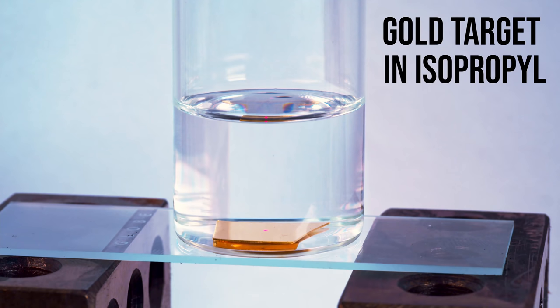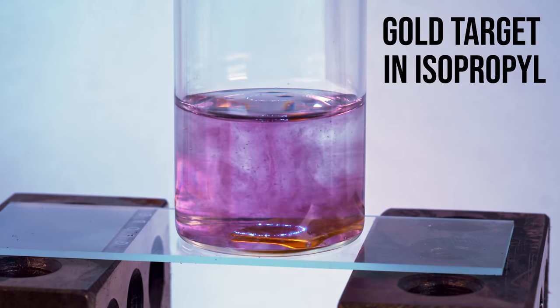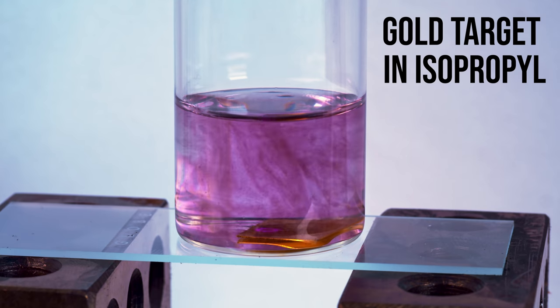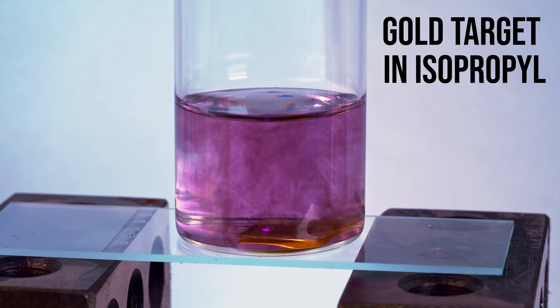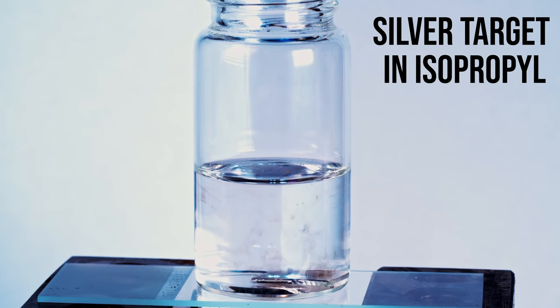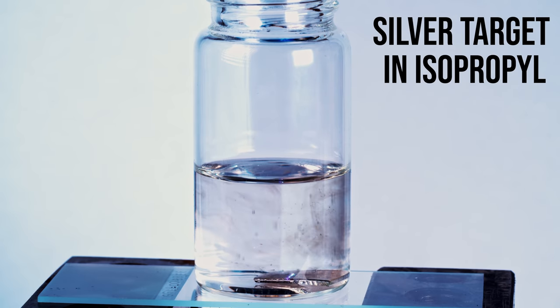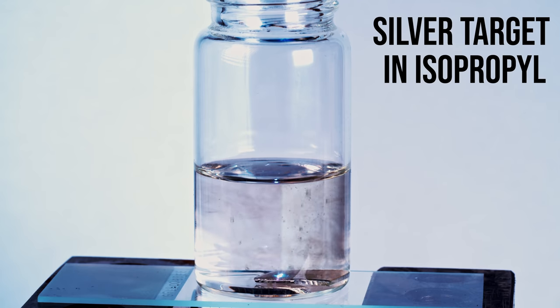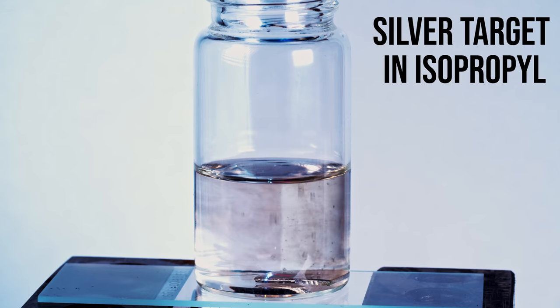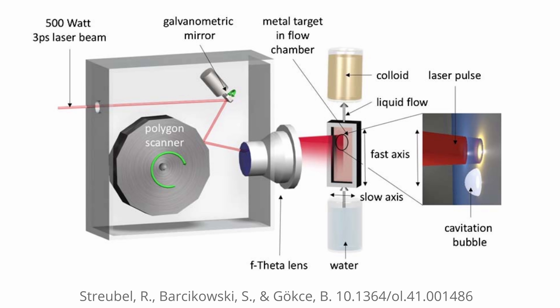The substrate is typically a metal, although it can be any material that ablates under your laser of choice. The liquid is most often distilled or deionized water, although organic solvents like ethanol, methanol, or acetone are frequently used for different effects. The laser is typically a near-infrared laser like an Nd:YAG, or in my case a fiber laser. It has to be a pulsed laser because you need really high peak energy to actually ablate the material in the liquid. I let my samples run for about five minutes each, and this can be scaled up easily using bigger lasers, more lasers in parallel, or continuous flow systems.